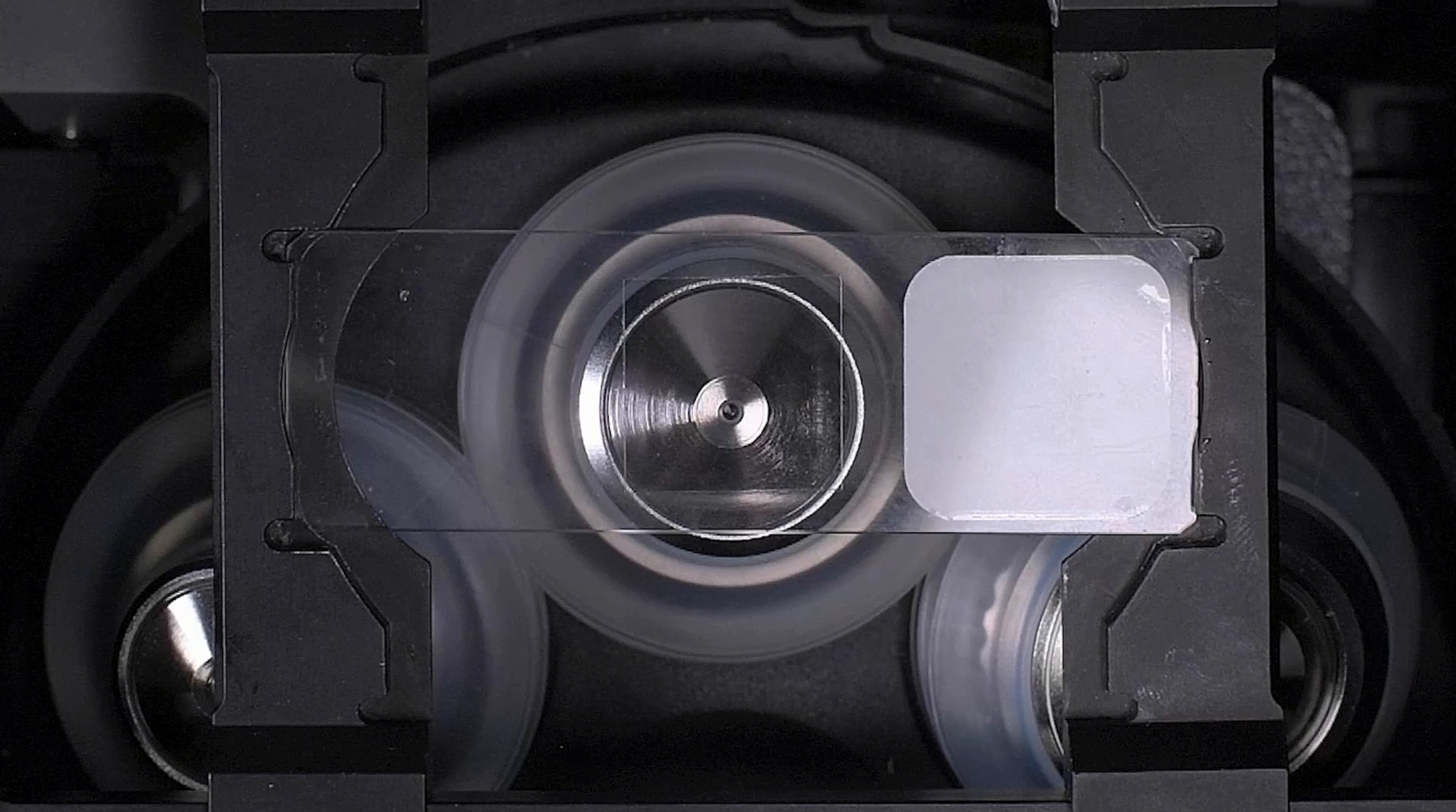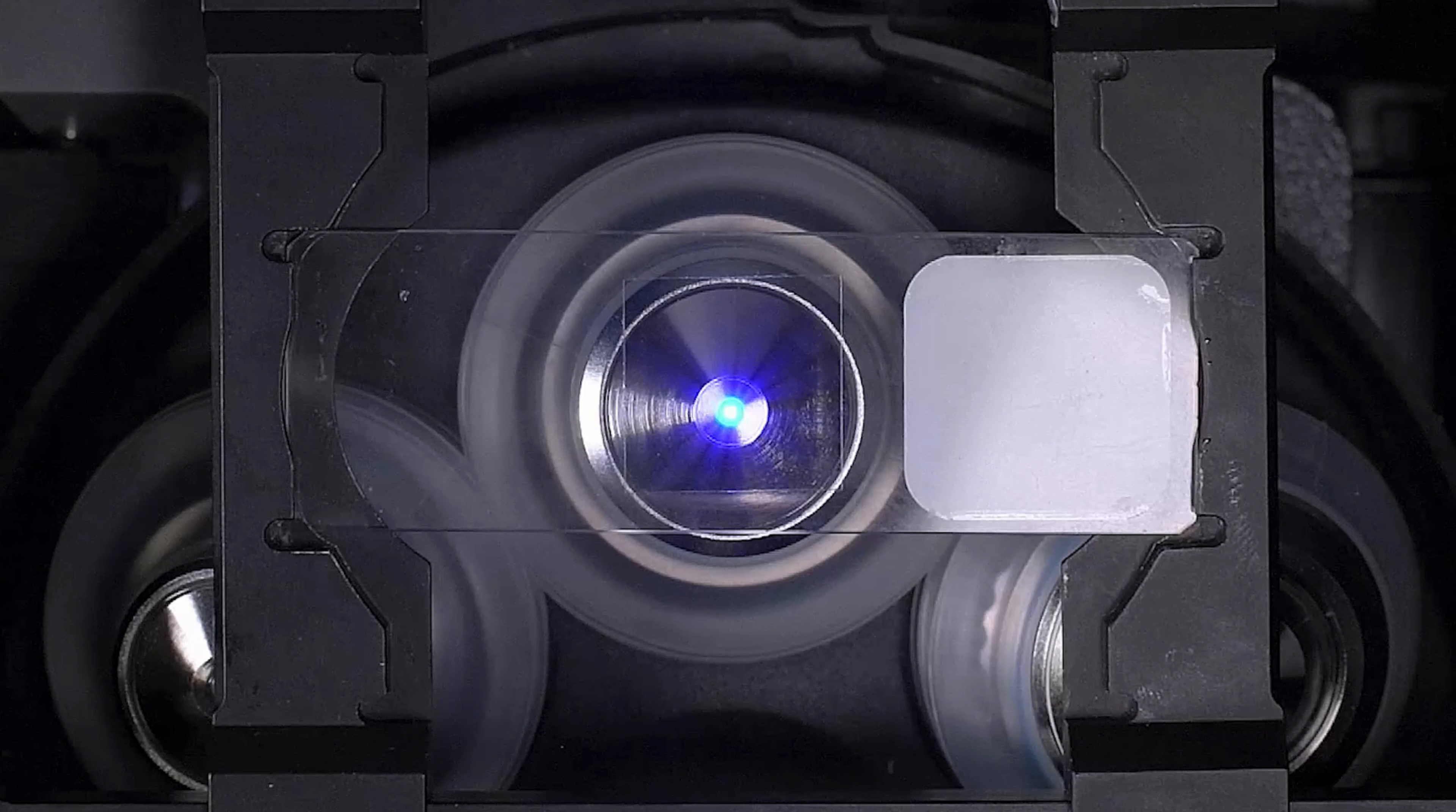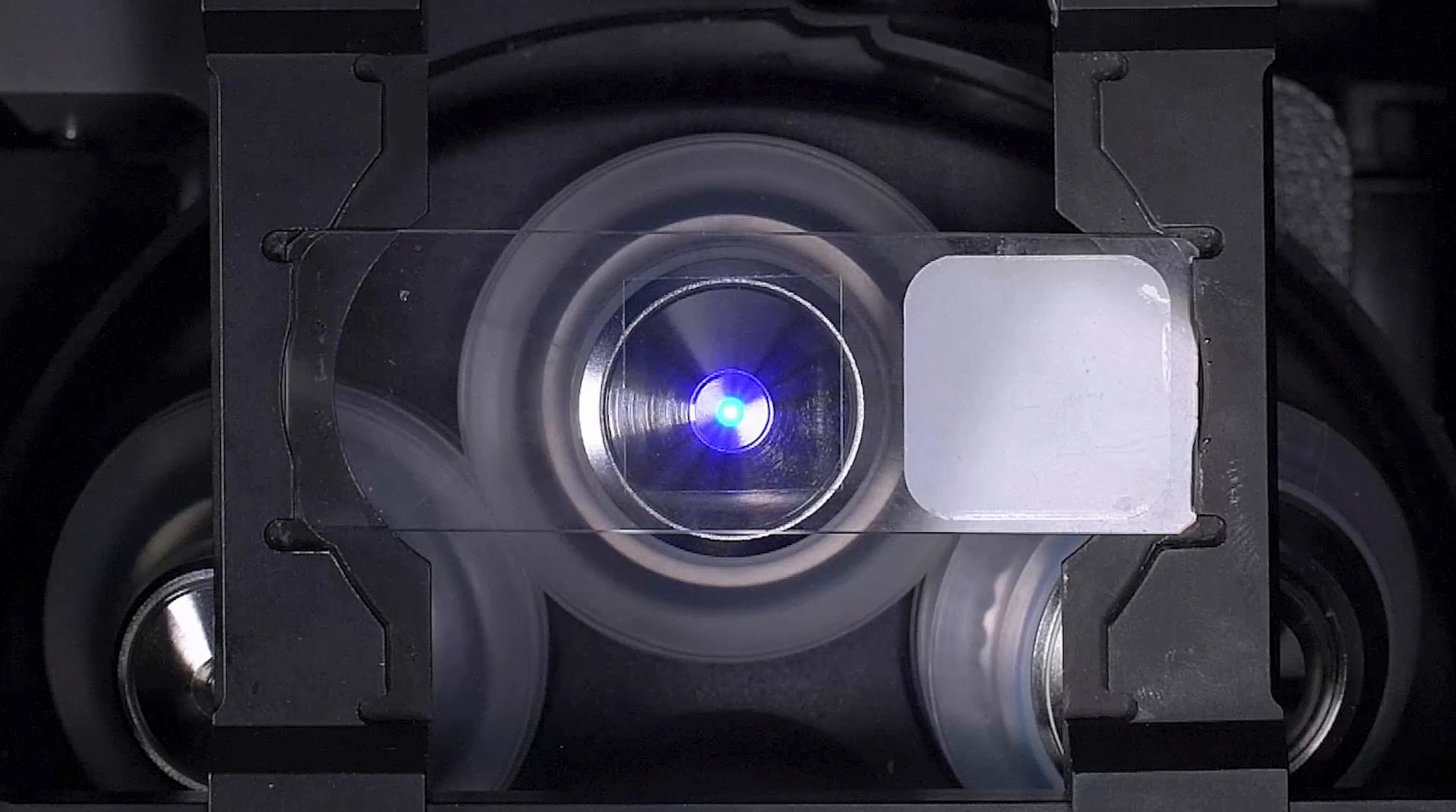If you have to travel very large distances, for example if you have a slide that has two adult mouse brain sections on it, we recommend that you move between the sections using the same method we used to change samples. Do not expect a single bead of oil to cover the distance of an entire slide.